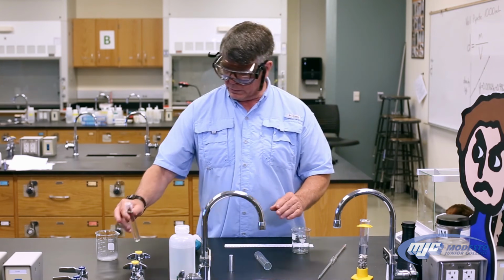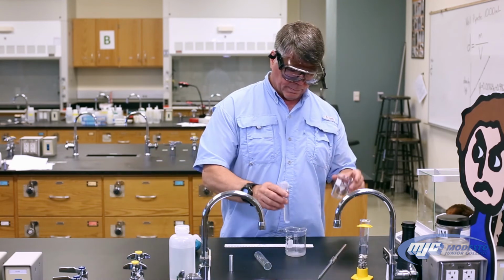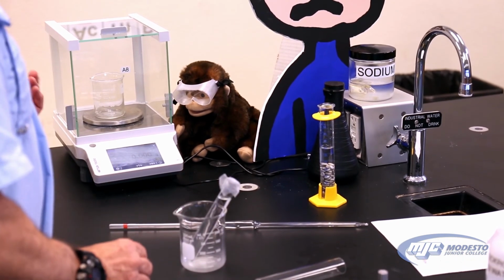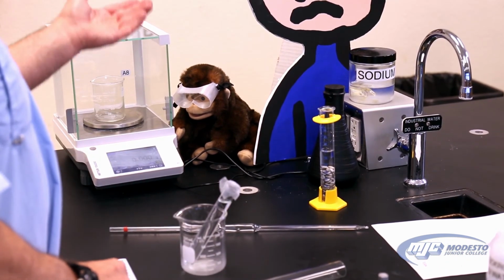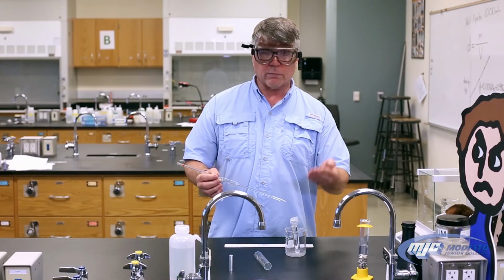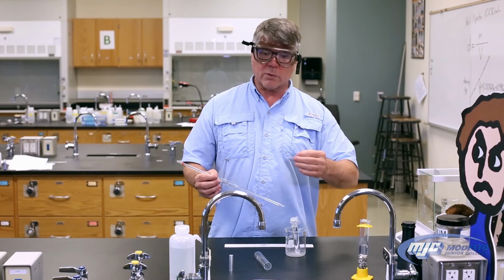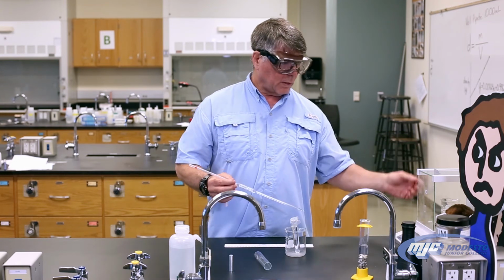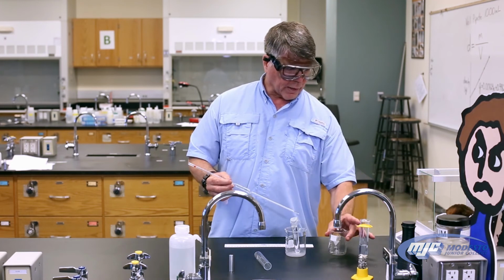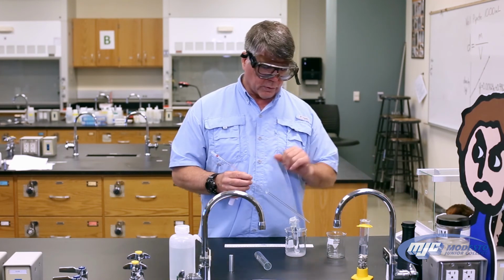So what we do is take an empty beaker, place it on the balance, tare the balance. Now it says 0 with the empty beaker on there, and we're going to use a volumetric pipette to transfer 10.00 milliliters of unknown solution into the beaker. Never transfer anything directly onto the balance, so we take the beaker out. Make sure we don't touch anything there so we don't lose our tare.